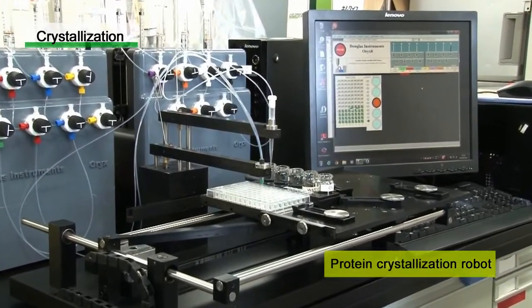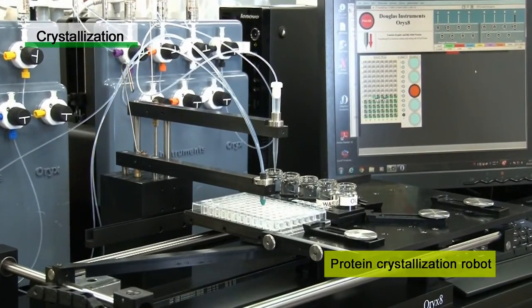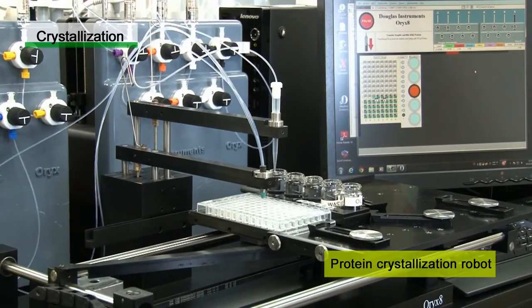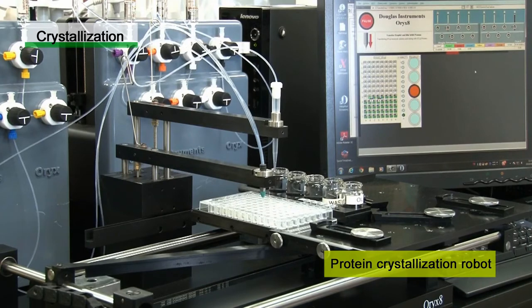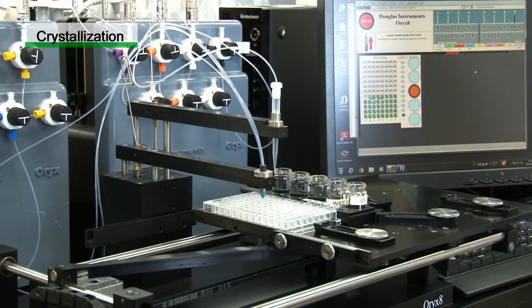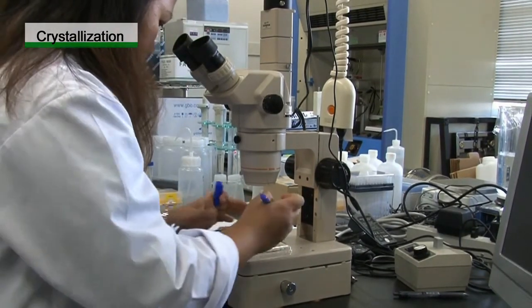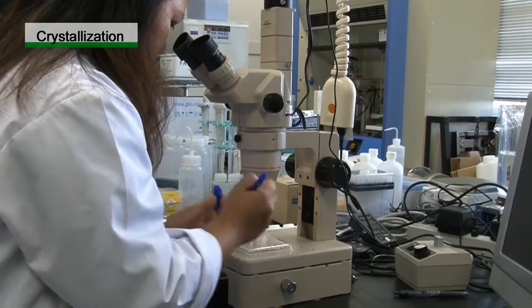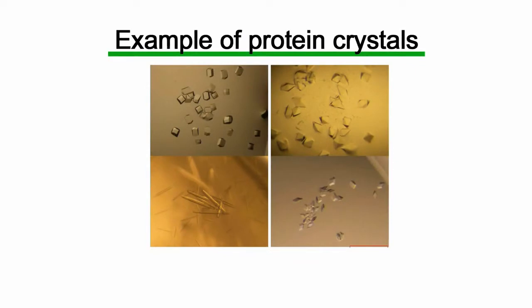Currently, robots are being used to crystallize proteins. The use of crystallization robots enables a larger number of trials under various conditions with smaller amounts of proteins and increases the chance of finding suitable crystallization conditions. Then, protein crystals are visually inspected under a stereo microscope. These are examples of well-shaped protein crystals grown in suitable conditions.